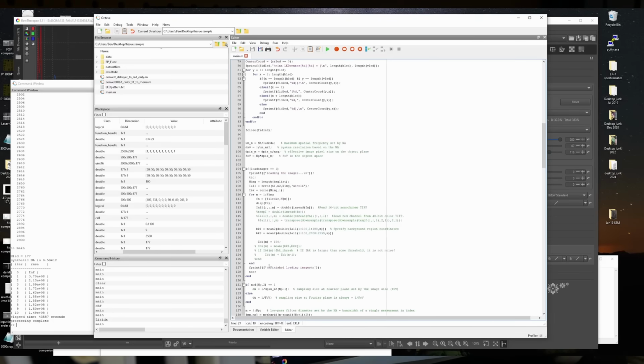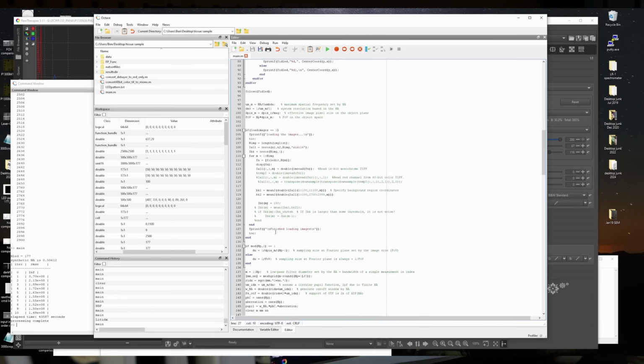This is where we start loading the images. Pretty straightforward there. There are a bunch of commented lines which take into account different types of images. One limitation is that RawTherapee can't produce mono images. They're all color. Even if you made a black and white image in RawTherapee, it just stores the same value for red, green, and blue. So to make things easier, this thing can just pick out one channel if you want.